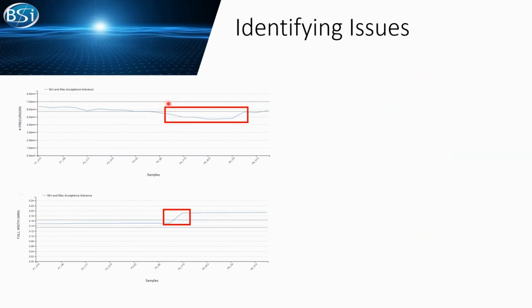So in here, we can see there is a precursor line chart. You can see, okay, from the plate 4 injection up to 6, we have a low precursor count. Actually, this trend starts from plate 3. So this problem is only below threshold in this run, but may also extend further upstream.